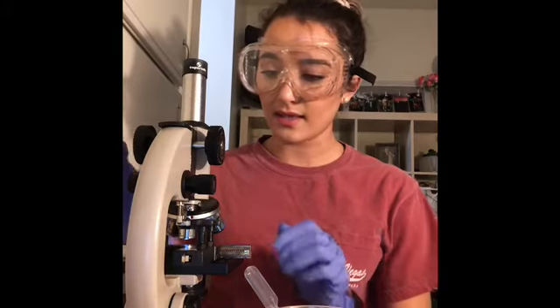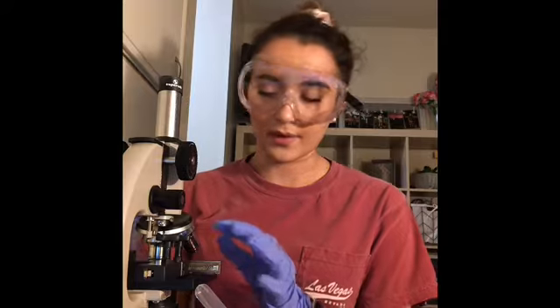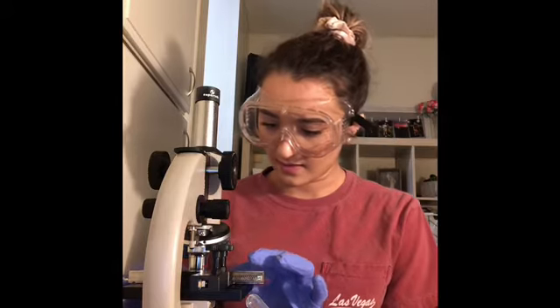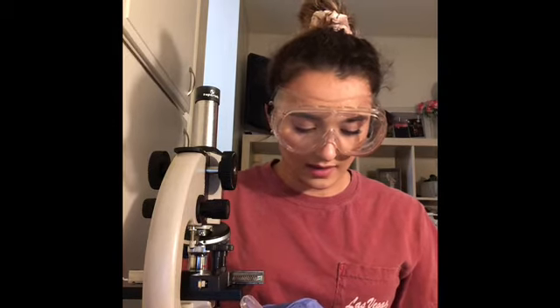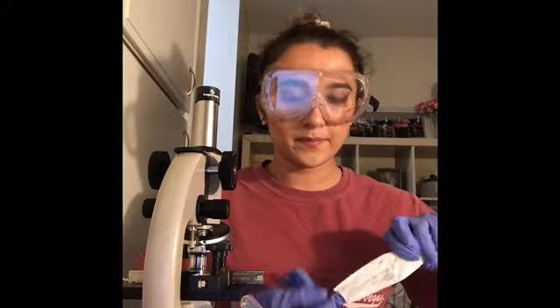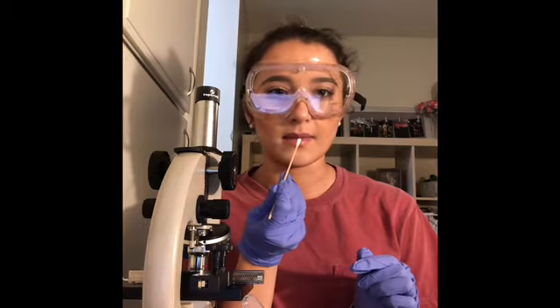I've looked in the microscope. Now I will, with the scanning lens, now I'm going to switch it to low power mode. Looked at the slide under low power mode. Now I will switch to high power. Remove this slide from my microscope and get a new slide and a sterile swab, and I'm going to wipe this along my gums where my teeth are.